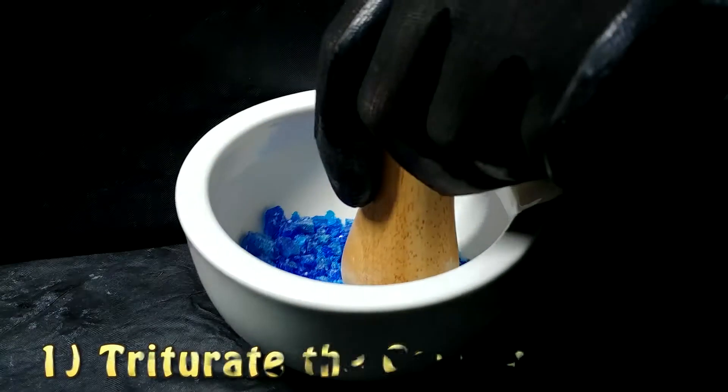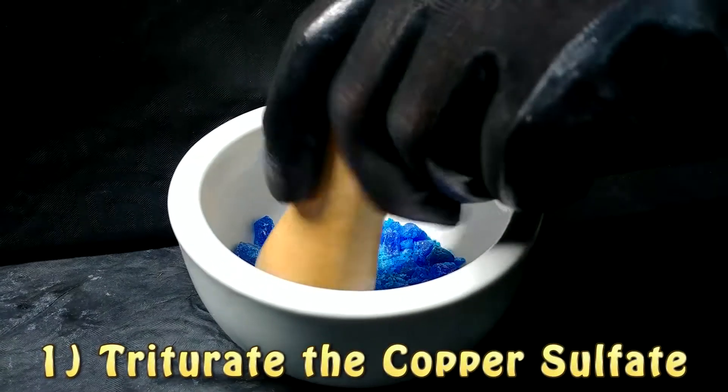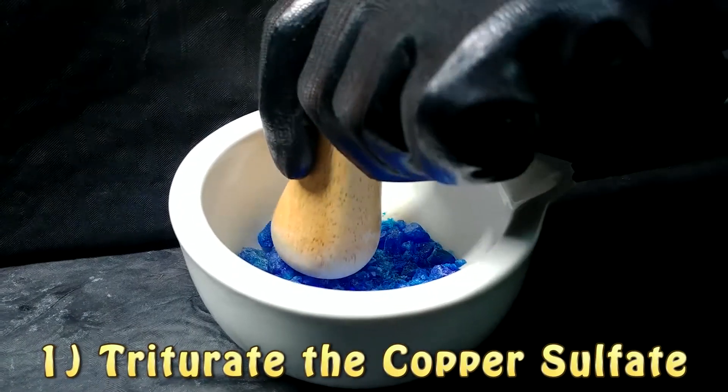In this video we are going to try to synthesize some copper compound and with this we are going to show you something amazing by mixing it with aluminum. So let's see this wonderful experiment. We will begin by preparing a solution of copper sulfate.